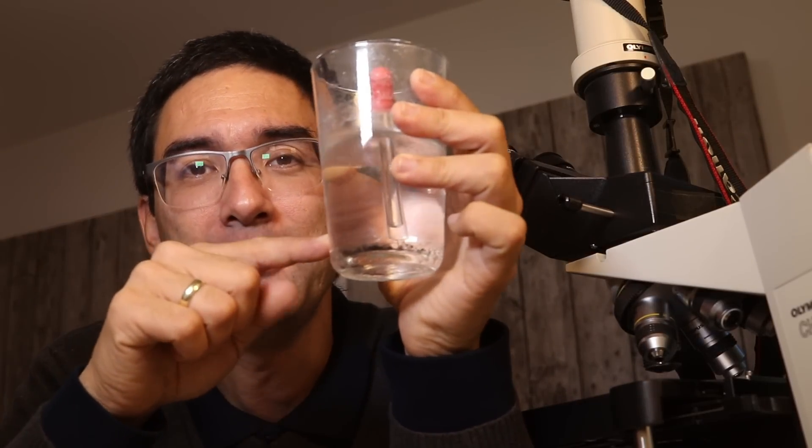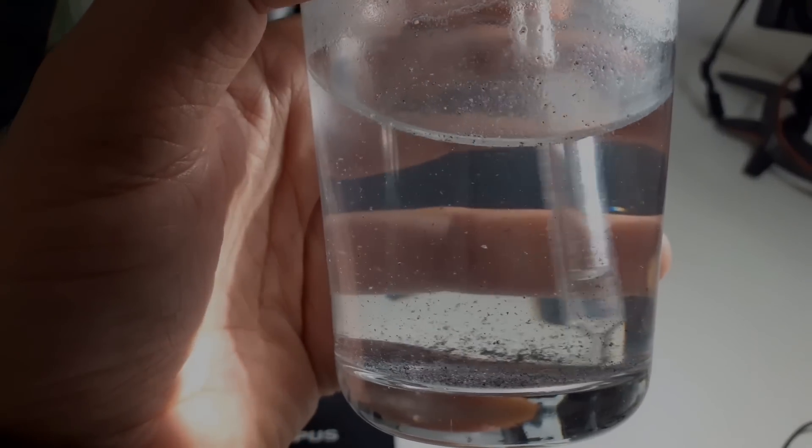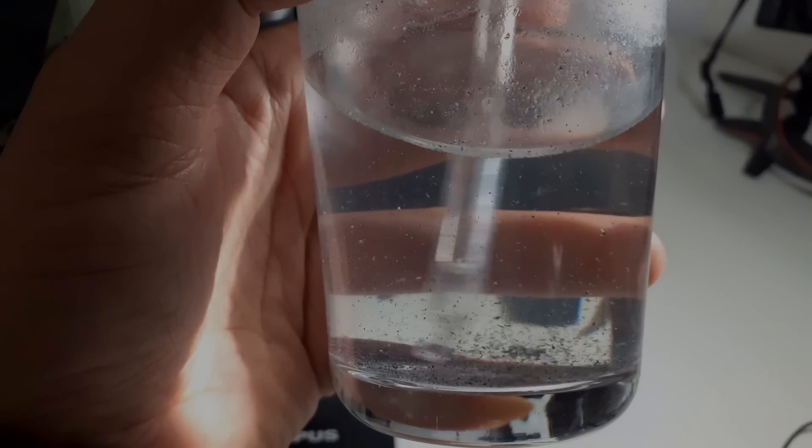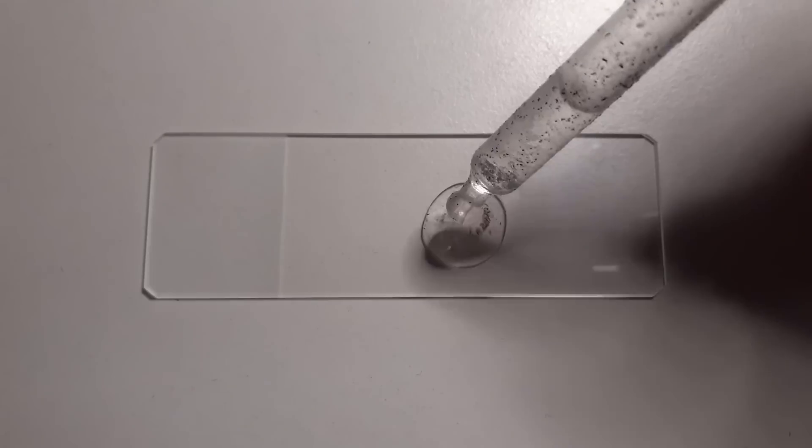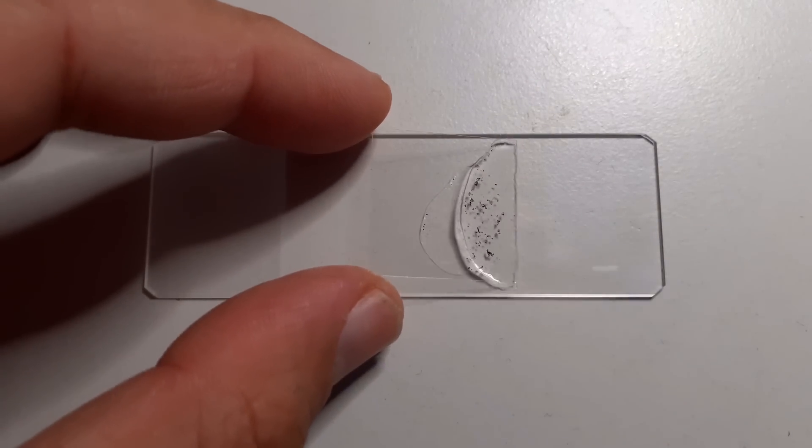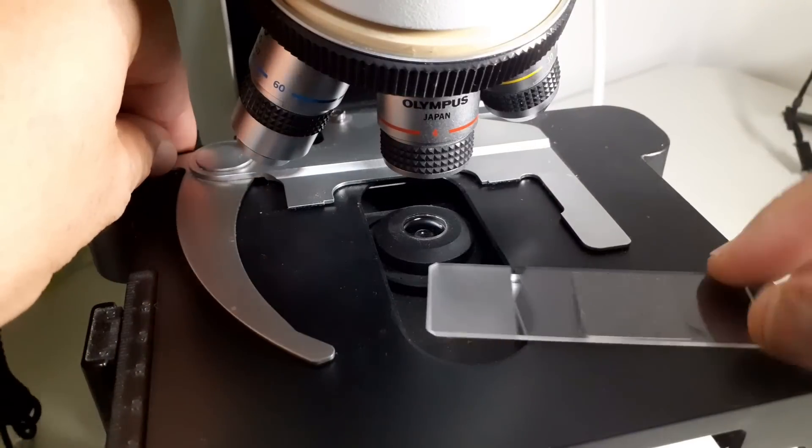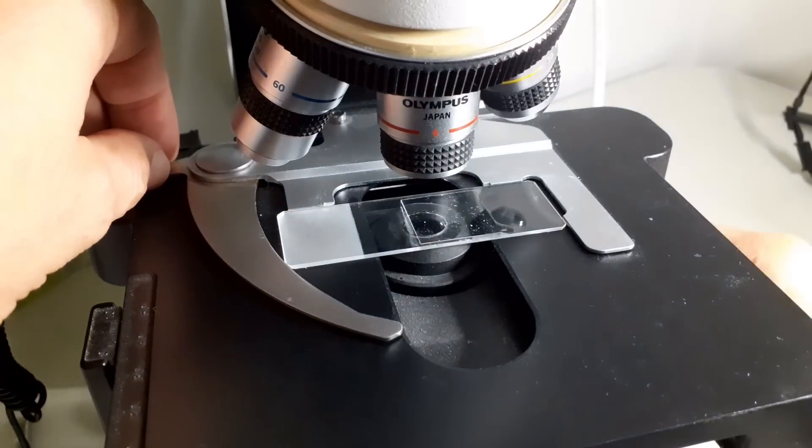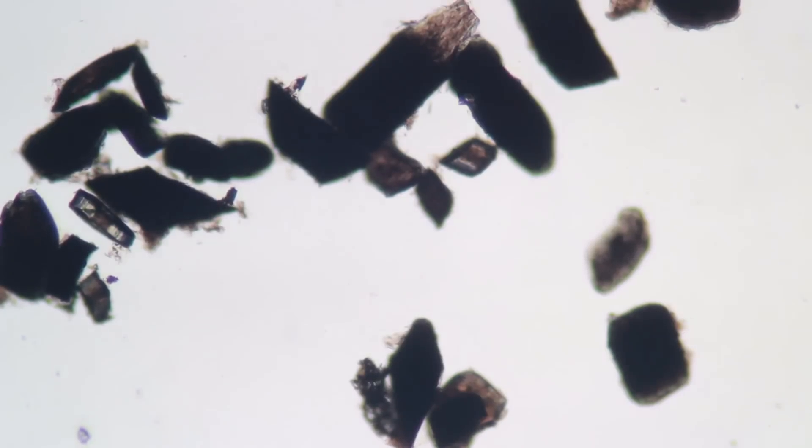I took a sample, put it under the microscope, and saw something that really surprised me: I saw ciliates growing in the beard. I was growing some life in here. I took a small sample with a pipette and placed it on a microscope slide, cover glass goes on top, and then everything goes under the microscope.